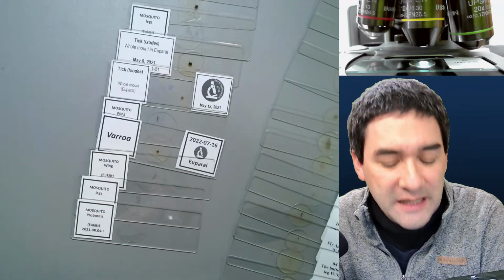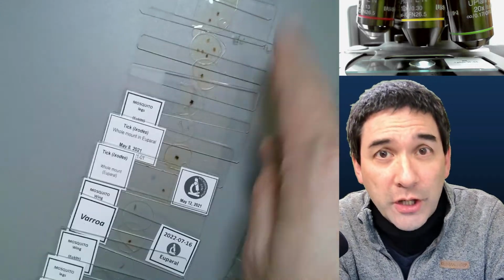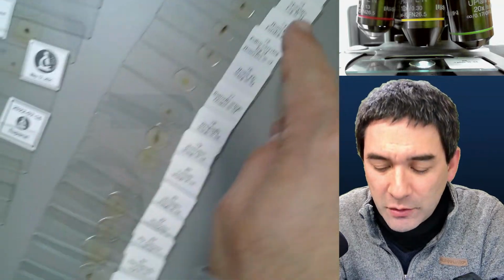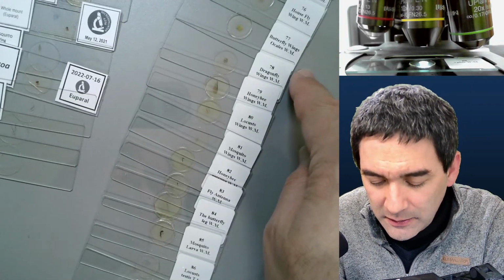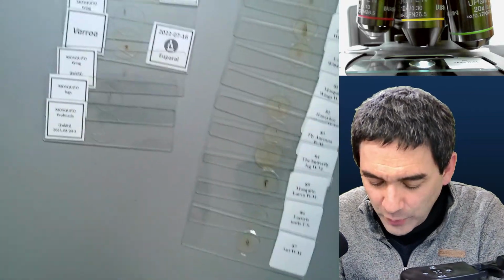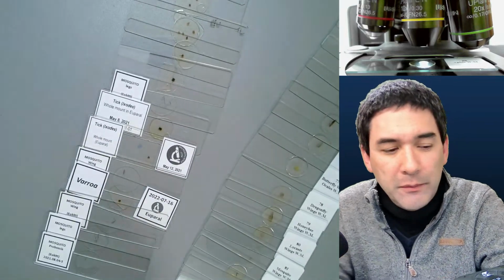We'll talk about this later, but over here I've also got some mites, some of which I already showed you in the previous live stream, the Varroa mites, but there are plenty of other specimens over here that I did not look at yet. Butterfly wing, dragonfly wing, honeybee wing, different types of wings, and so on. So we're going to have a look at those, and it's going to be a little bit of a surprise to me as well. So that's a little bit the plan that I have for today.